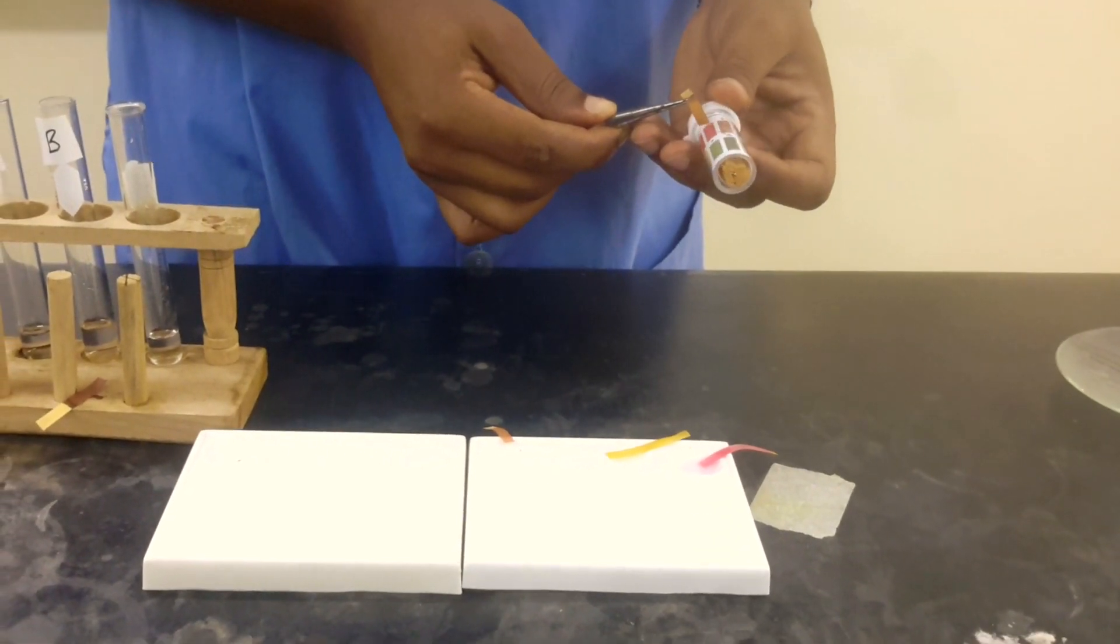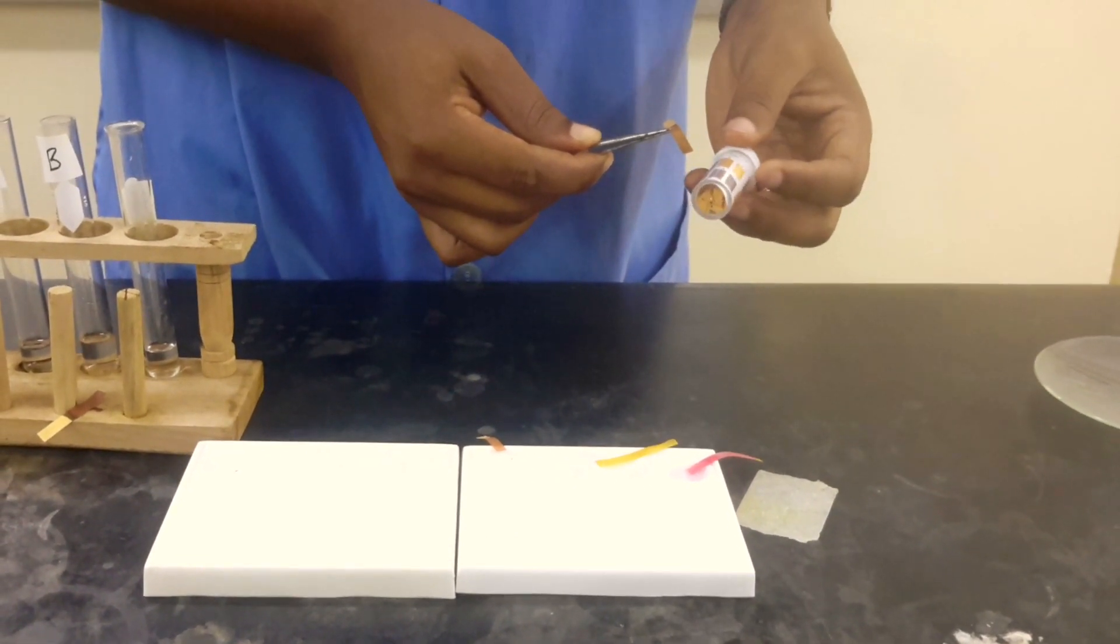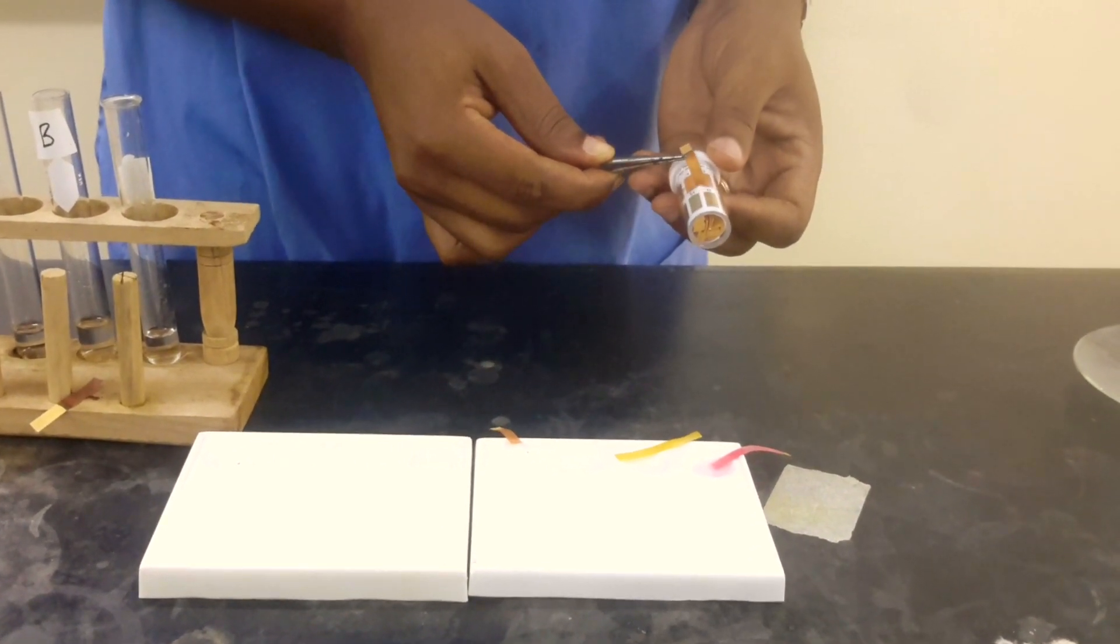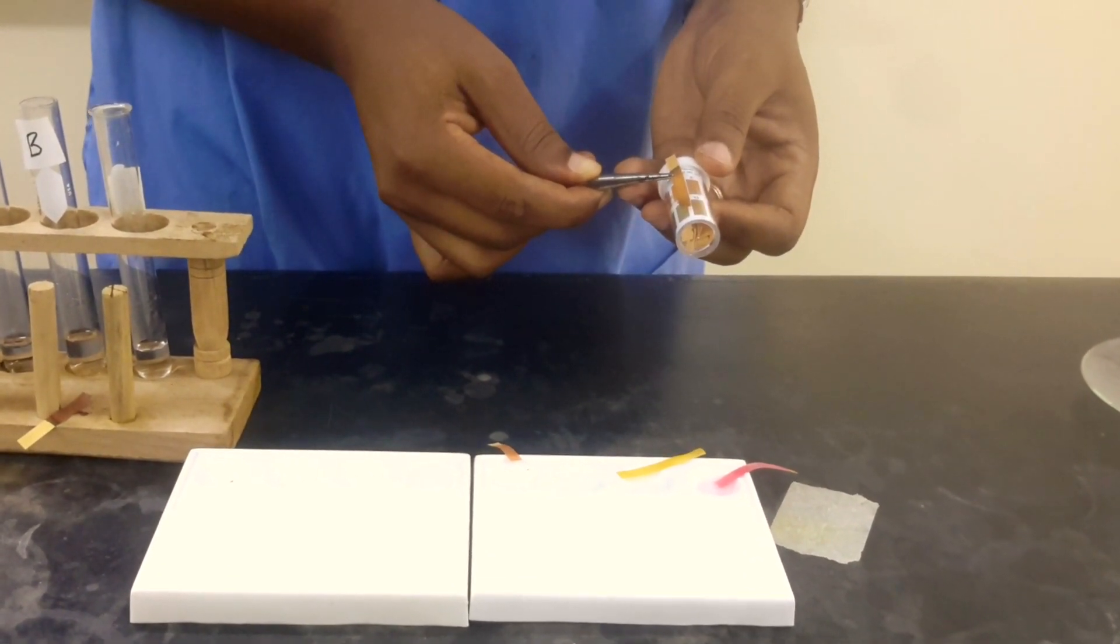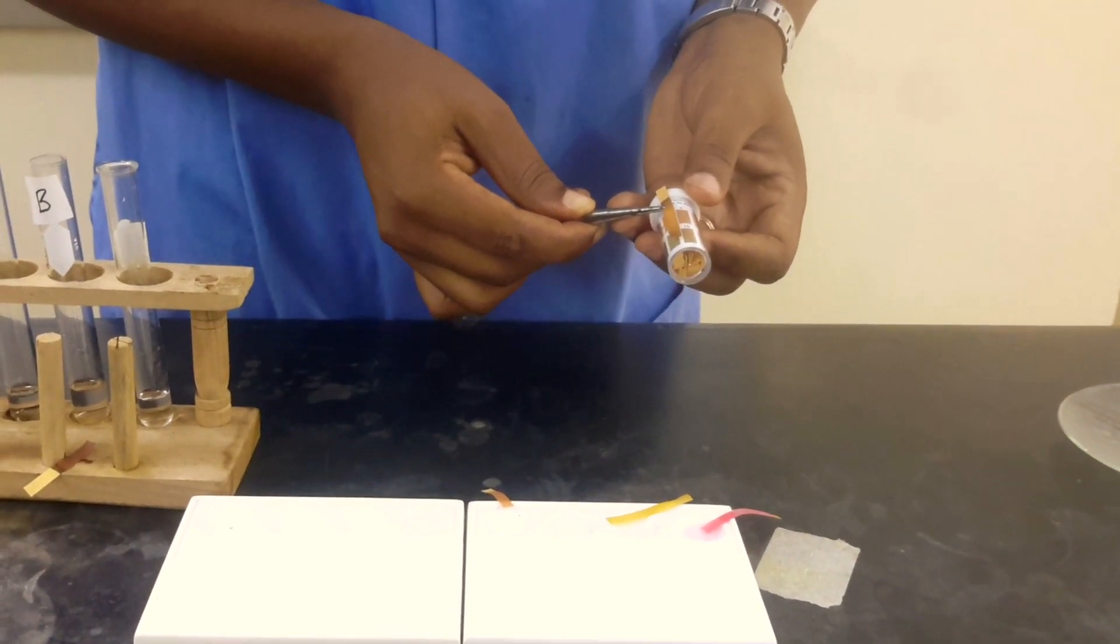Let's see, it's not 0, 1, 2, 3, not 5. Let's see, this is looking like 12. This is looking like 12.